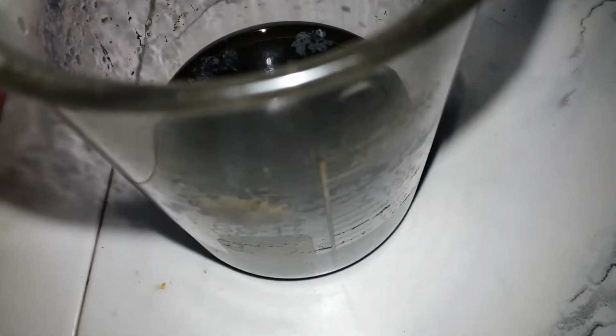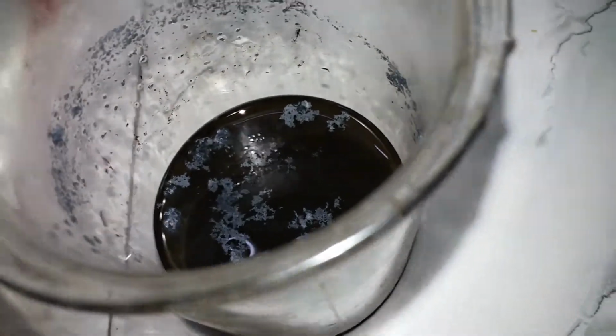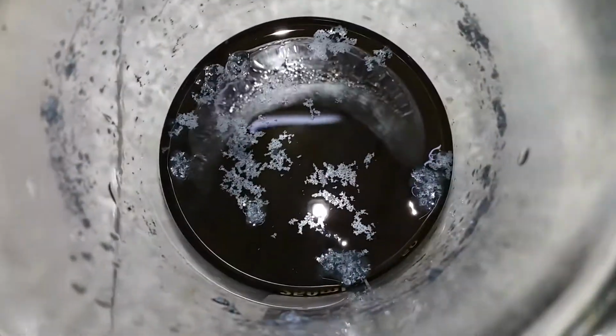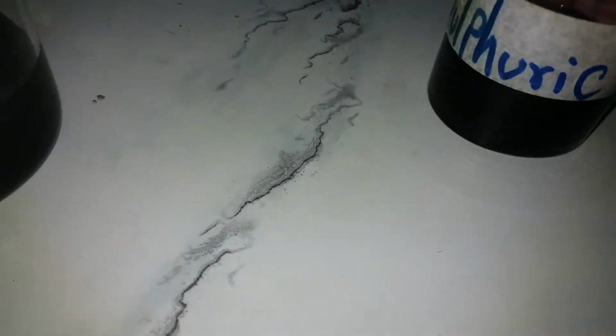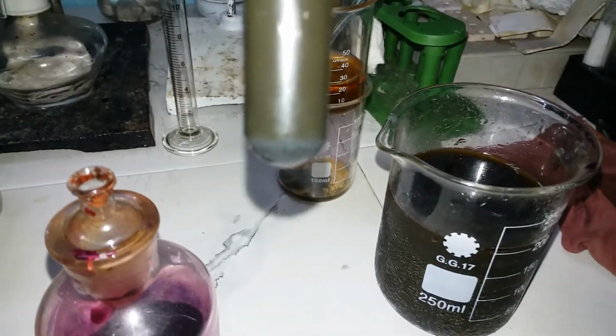But, well, it was not worth it for my nitric acid, because nitric acid is more valuable to me than iodine. So, well, still I got iodine, but I made another batch testing out why it didn't happen, and I don't know why it still did not. But this time I used potassium permanganate solution. Just ignore the label. Potassium permanganate solution, and that worked just fine. A small sample. You can see some iodine at the bottom.